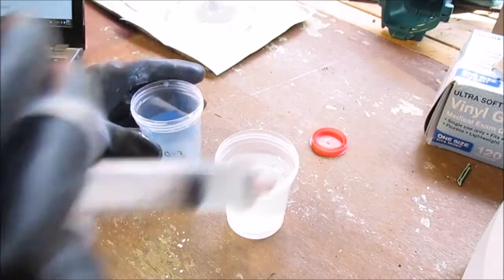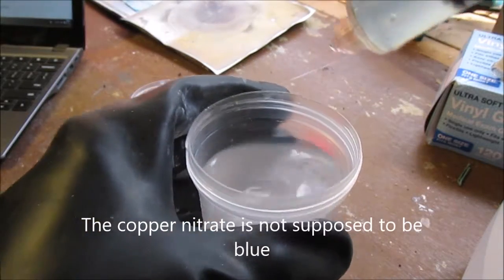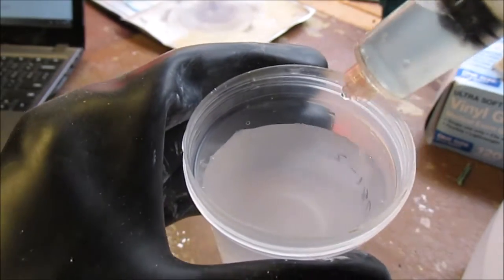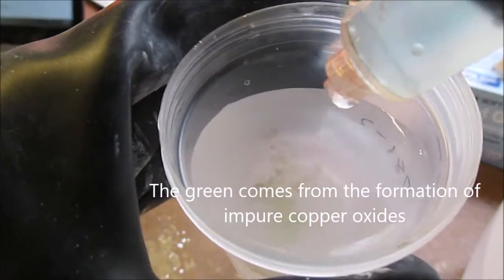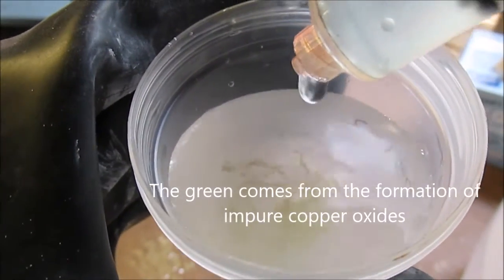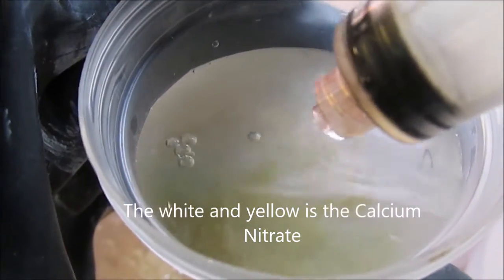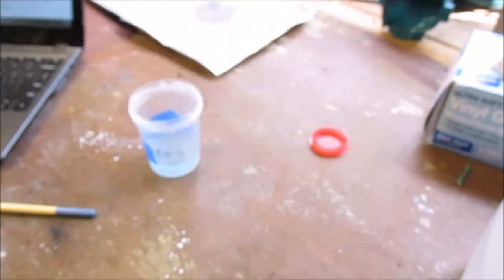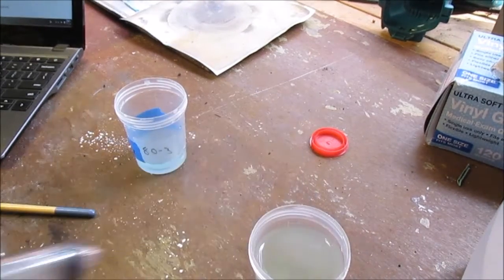Copper nitrate right there. You'll notice this stuff is slightly blue — it isn't really supposed to be, but that's because I made this at home, so there's sulfate in it, copper sulfate, copper hydroxide. It's very similar to the copper peroxide I made a few days ago. Yeah, it looks almost yellow. And that, my friends, is Norwegian saltpeter — that demonstrates the reaction, at least in principle.